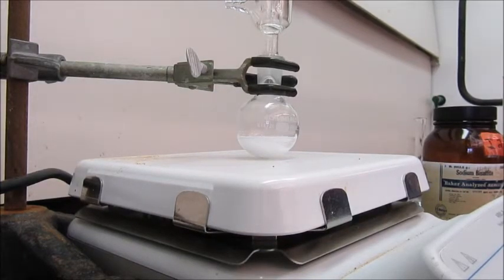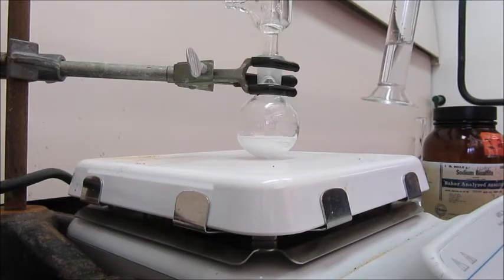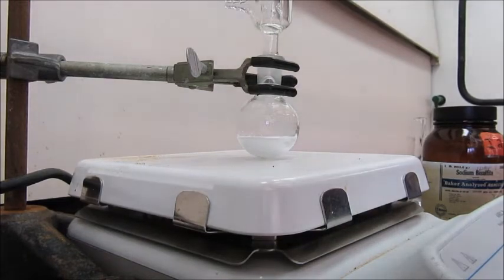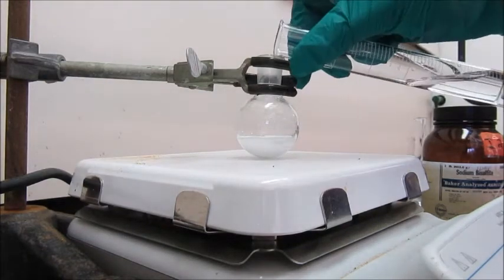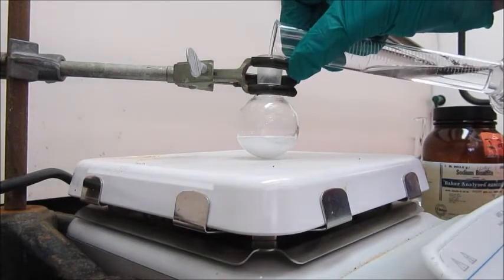Now we need to work up the reaction and I'm going to start by adding 15 milliliters of distilled water, which I've prepared here, and watch what happens.